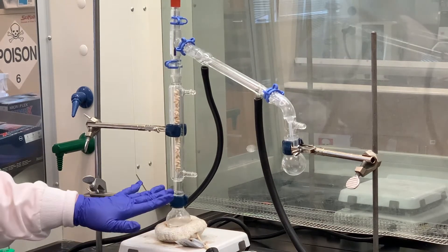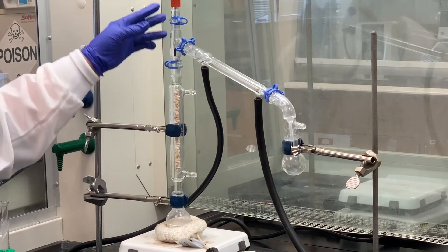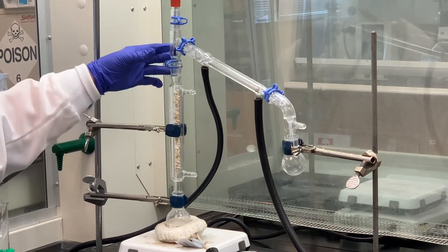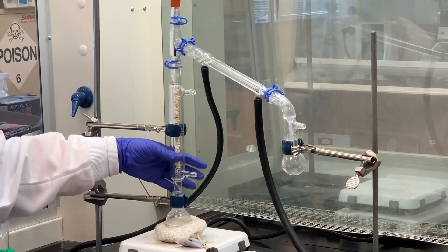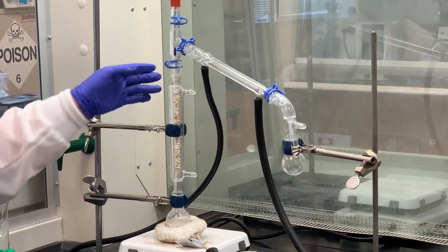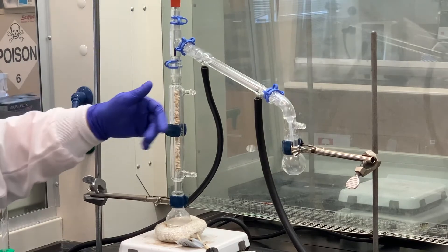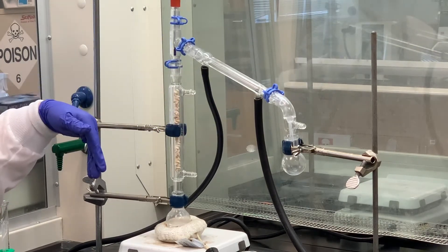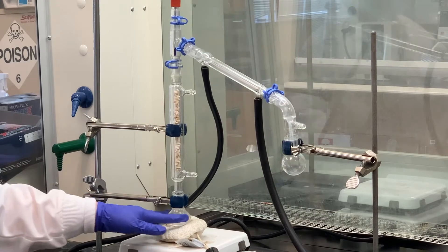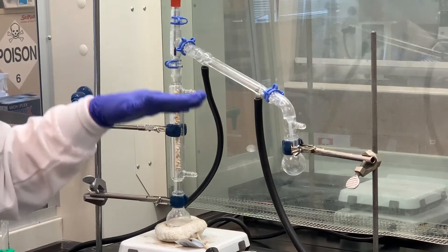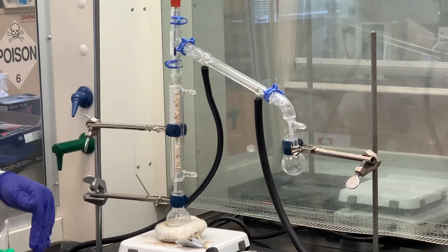So I'm going to turn this on. And again, any time you're doing a fractional distillation, then we want to cover this with aluminum foil. I will do that. Just wanted to let you see what it looked like beforehand. We've already done a fractional distillation. The only difference is we're actually making a compound in this one and purifying it by distilling it over.